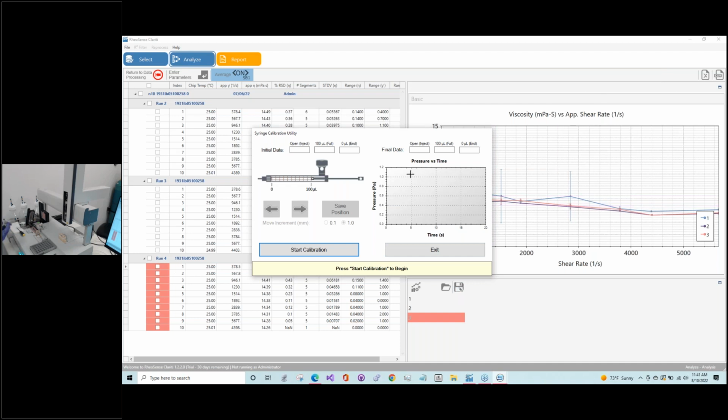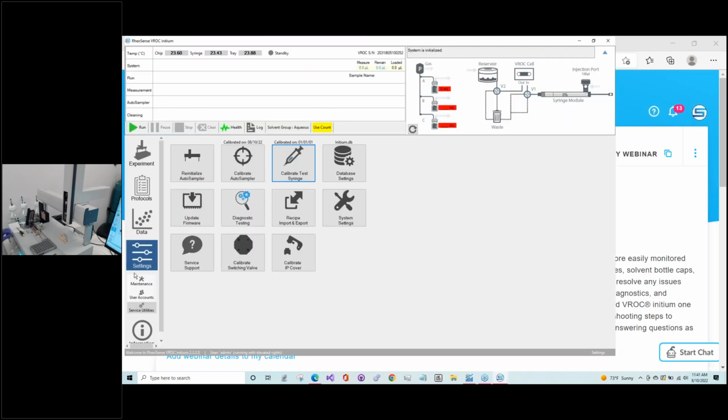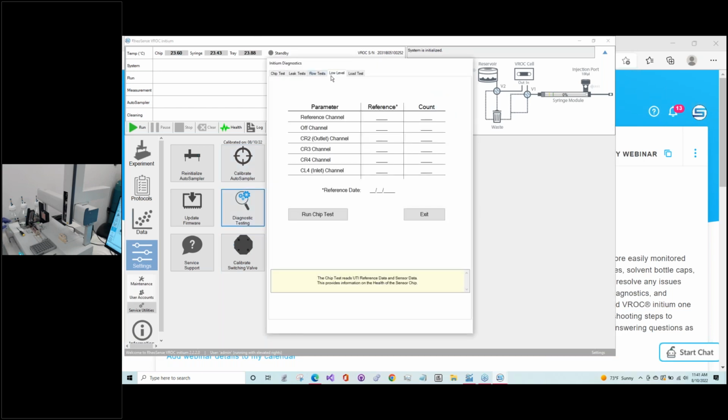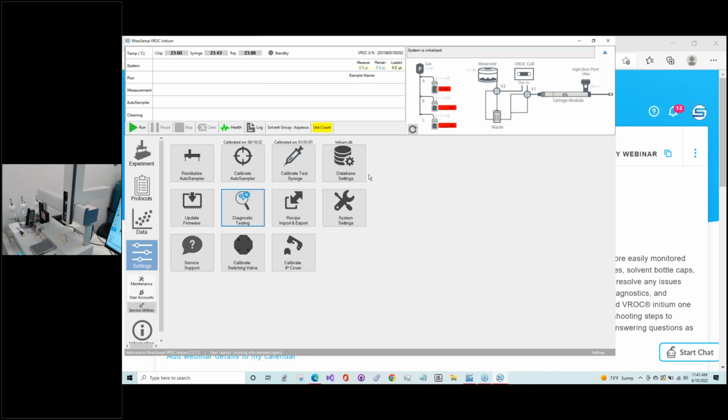And this is mostly, and I think actually we probably should have closed this first, so we can exit for a moment. Close IP cover. So we're just closing that injection port cover before we go back to this. Okay, so now it's closed. Back to calibrating the test syringe.